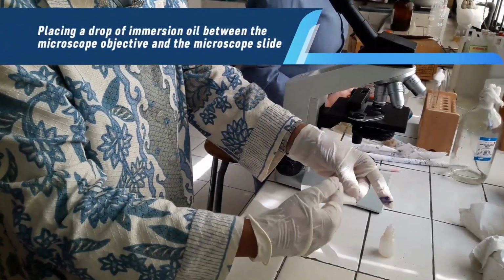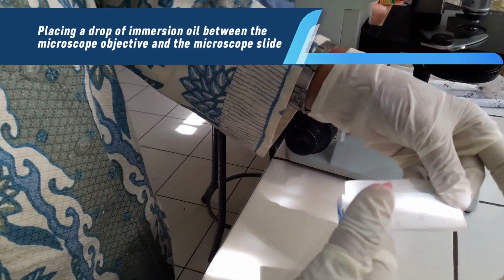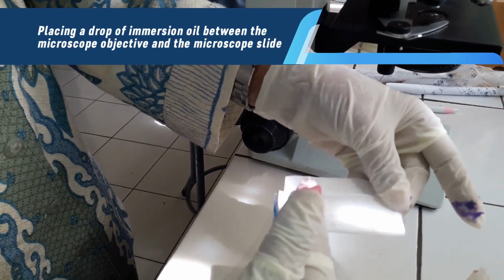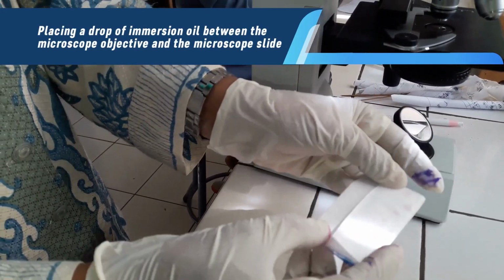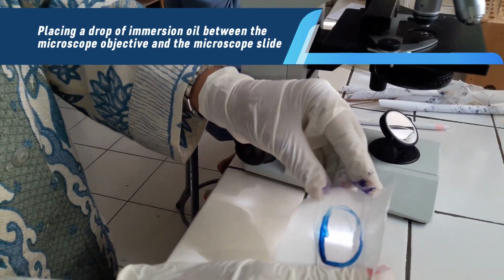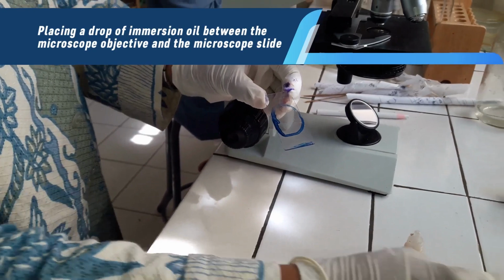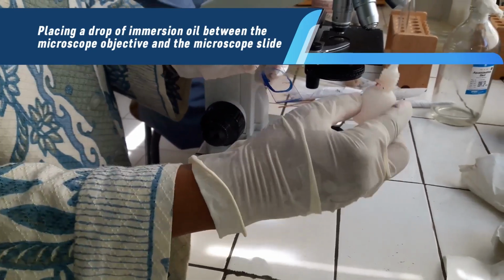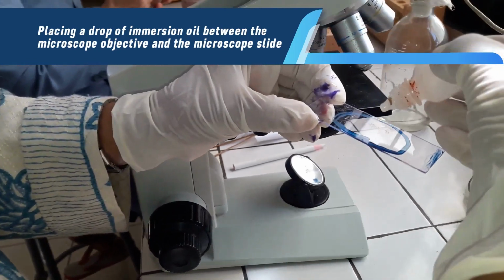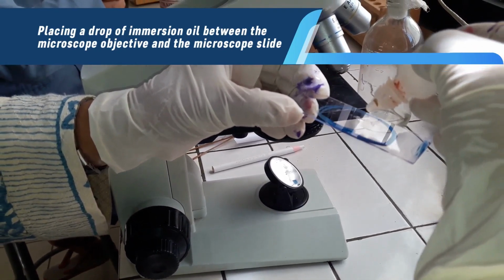Place a drop of immersion oil between the microscope objective and the microscope slide. To achieve high magnification, 1000x, with good resolution, the objective lens must be small. Although we want light traveling through the specimen and medium to refract differently, we do not want to lose light rays after they have passed through the stained specimen. To preserve the direction of light rays at the highest magnification, immersion oil is placed between the glass slide and the oil immersion objective lens.